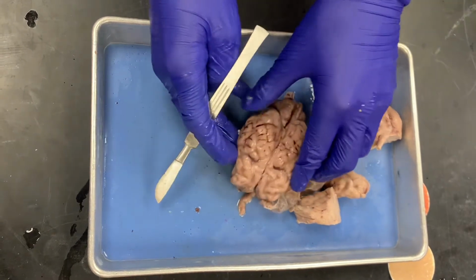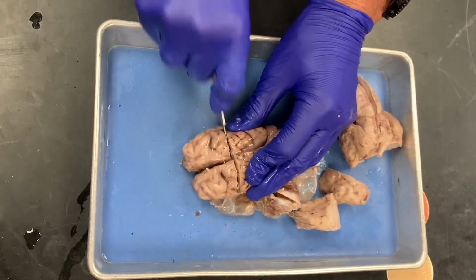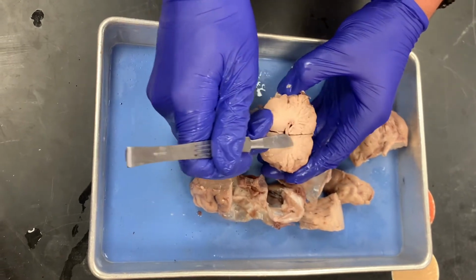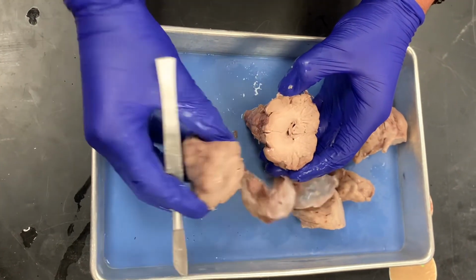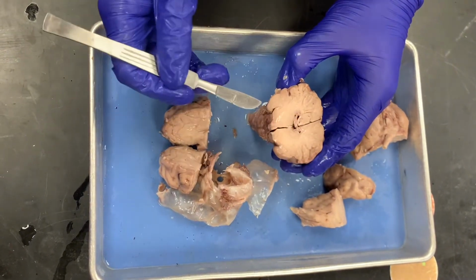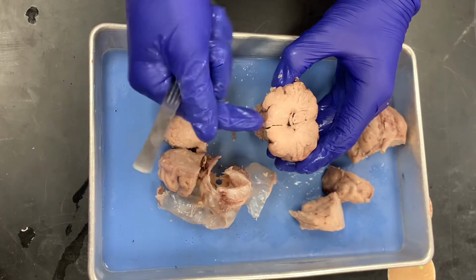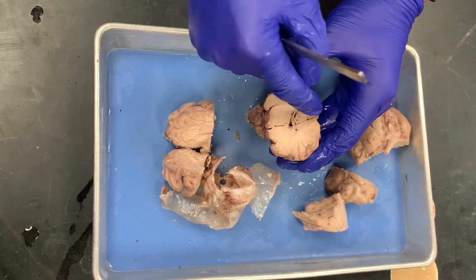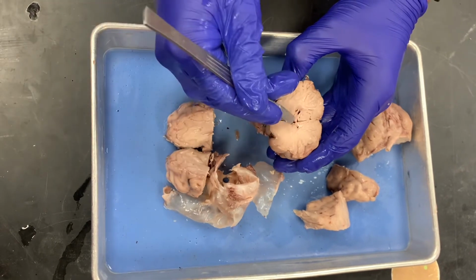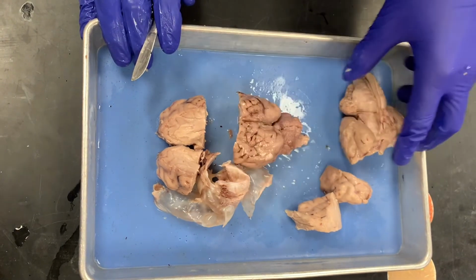So the next thing we want to do is a coronal section. So we'll cut it here, right in the middle. And then from this point of view, you can see the white matter, which is there on the inside. Let's compare it on this one. Yeah. So white matter is there on the inside, and then the gray matter is on the outside. So then this part is where the thalamus is. So remember, the thalamus is the gateway for the tracts. So all of the tracts are traveling through here to get to the cerebral cortex. And then you can also see the ventricles, which would be here in that region. Okay, so that's it.